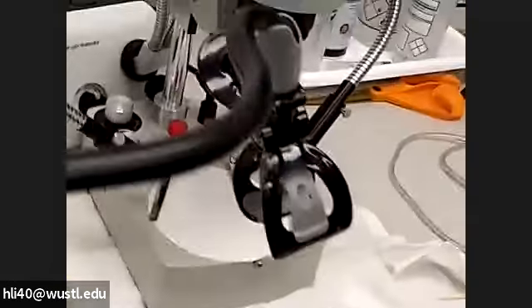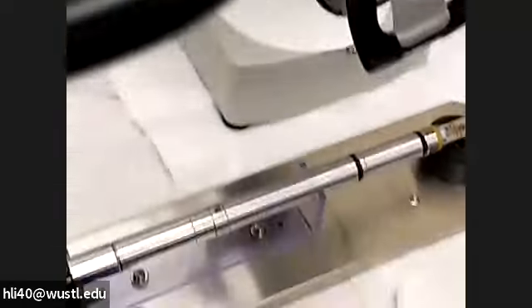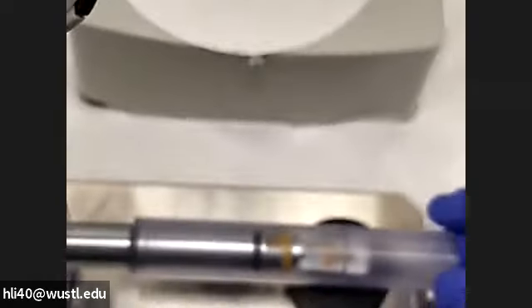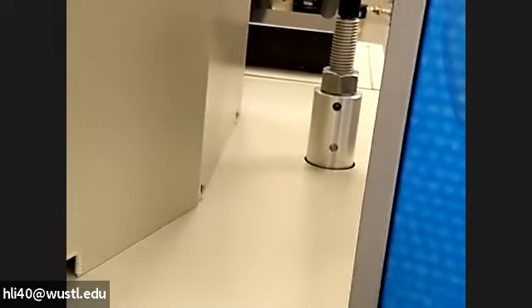This is how we remove the holder. Now we're going to land the holder on this place. When you land the holder, be careful, especially for the double-tilt holder. Single-tilt holder is not very tricky — you put it in this place, and then remove your sample, put the tube on. That's the end of session. You have to put the tube all the way to here. After that, you need to put the dummy holder in. The dummy holder normally we place here — this whole dummy holder. You take it out at the beginning of your session.